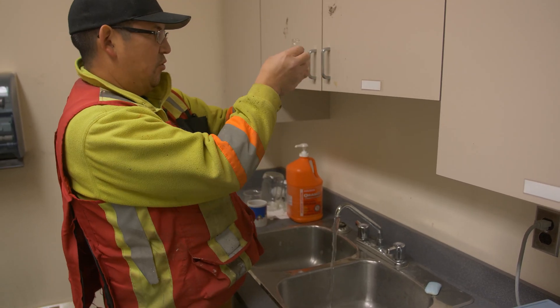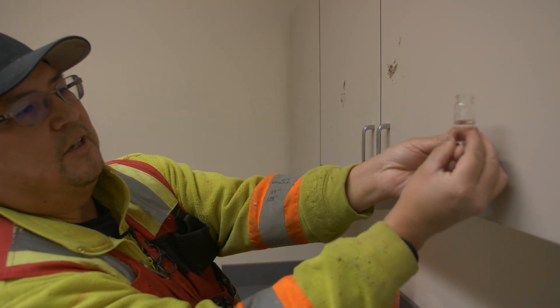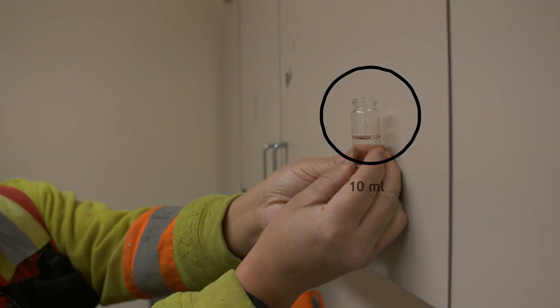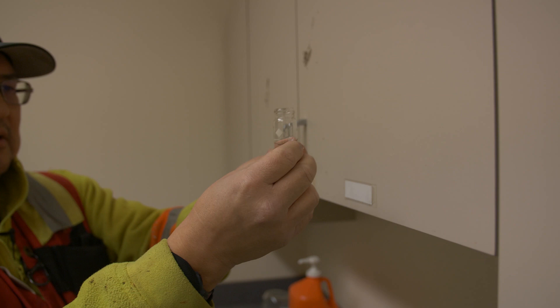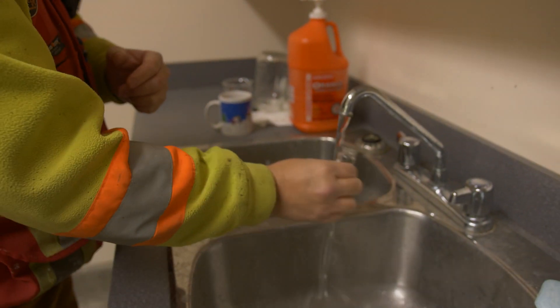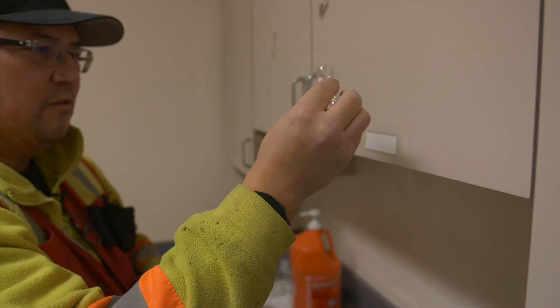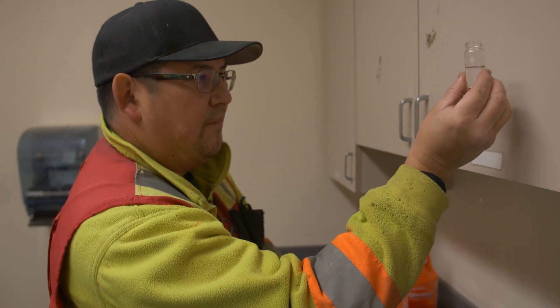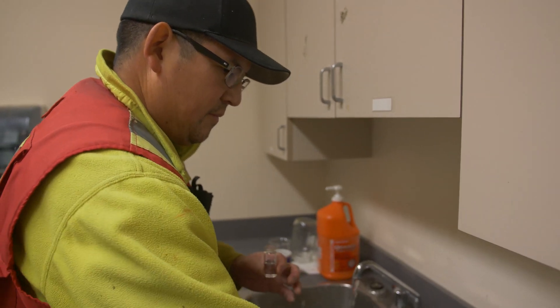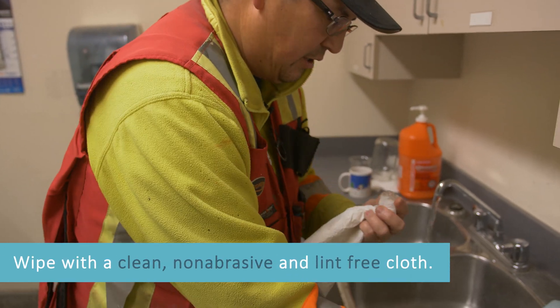There is a little line here that lets me know I'm up at the 10 milliliters mark. I'm just below it still, so I have to add a little more water. There are different techniques people use — I like to use a swipe just to get that last little bit. There we go, roughly the 10 mill mark. Wipe the jar, get rid of our fingerprints.